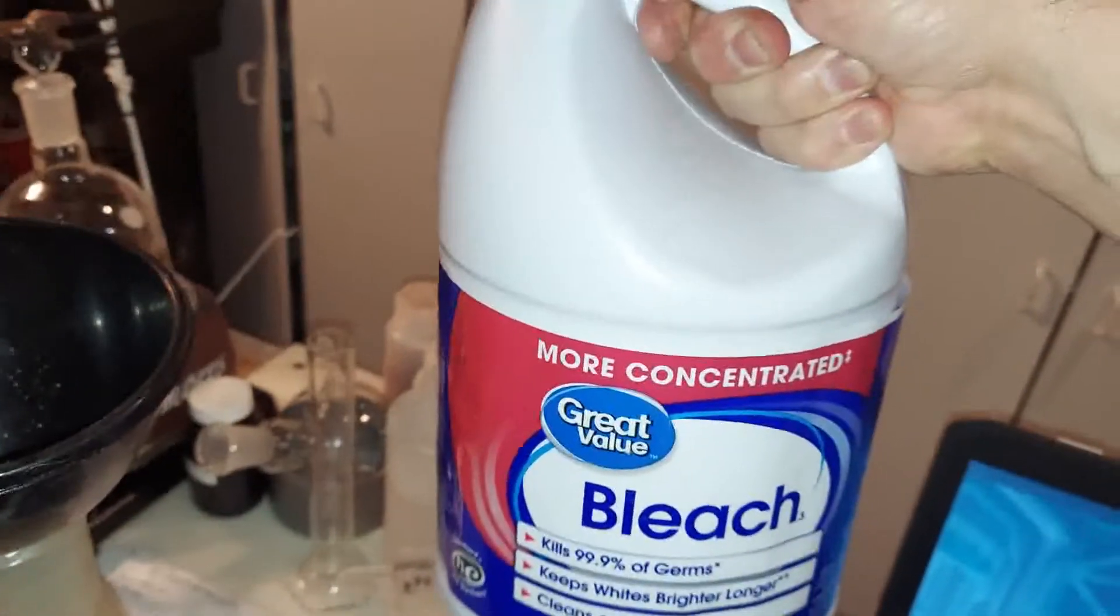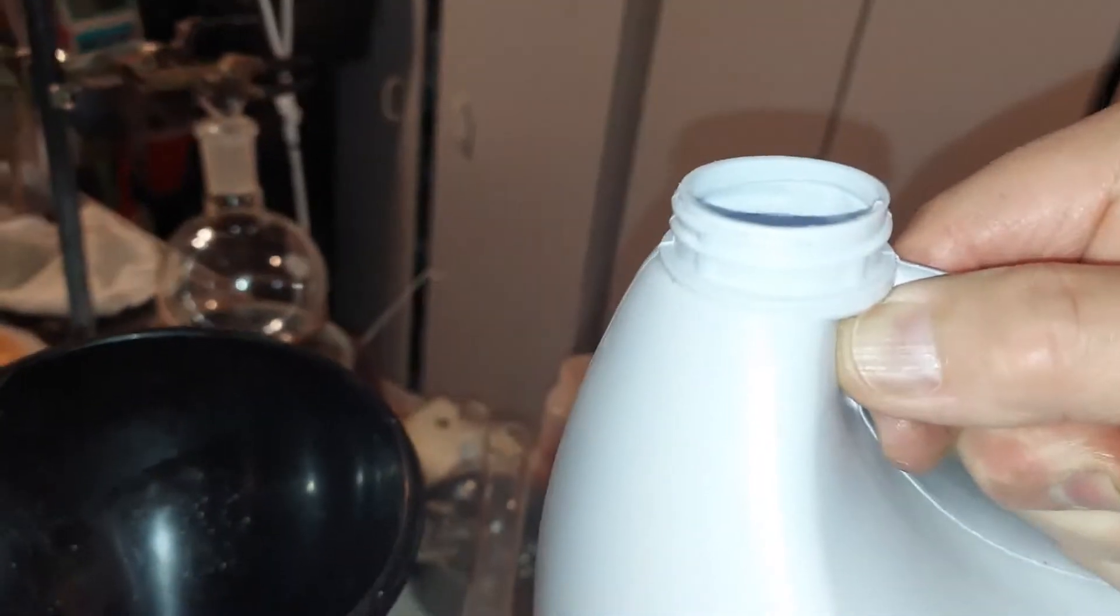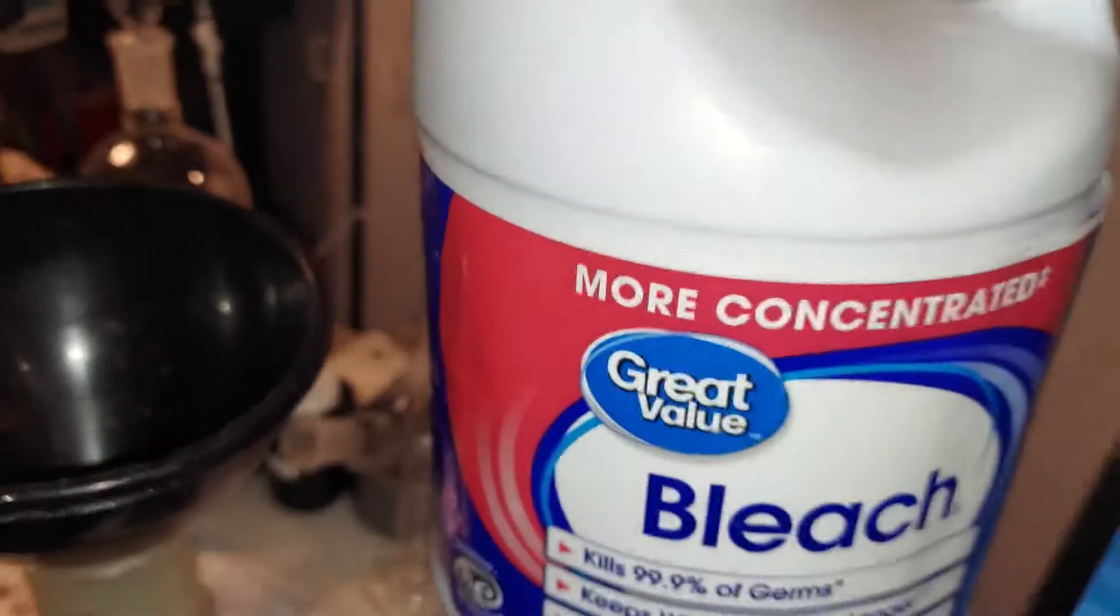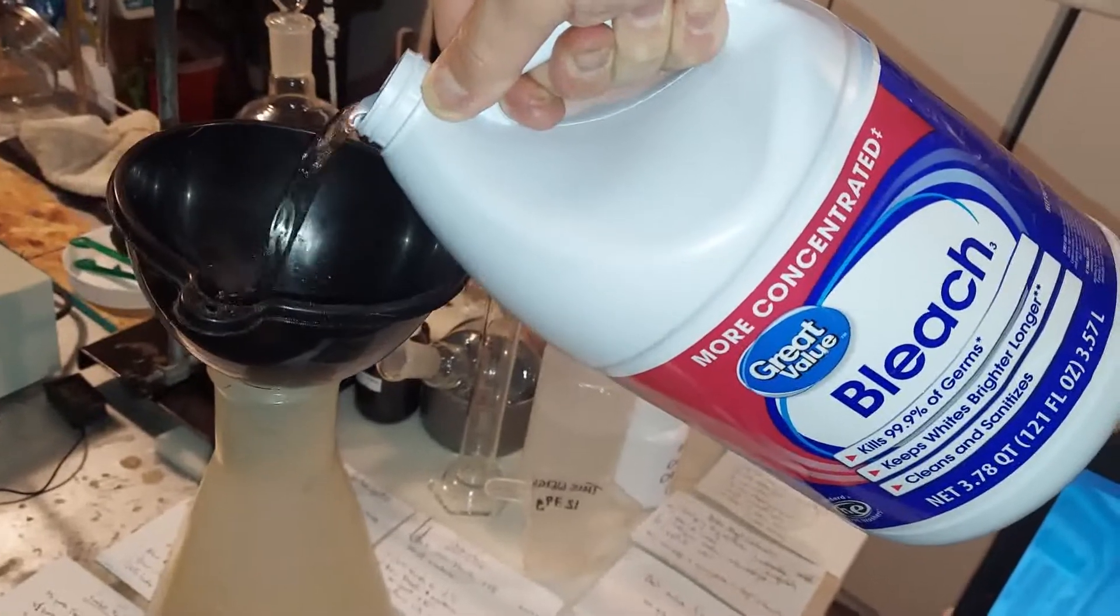Okay, done. After mixing the acetone in the bleach, this got really hot and it off-gassed quite a bit, so the cap was loose. It's still pretty warm, but I'm going to pour off the top portion, which would be mostly water and salt, believe it or not. And we're going to get rid of most of that right now.